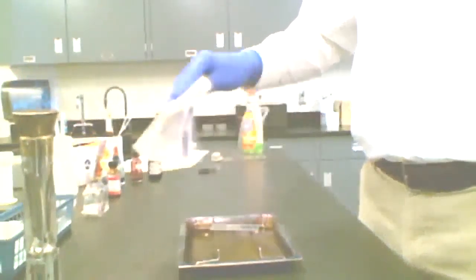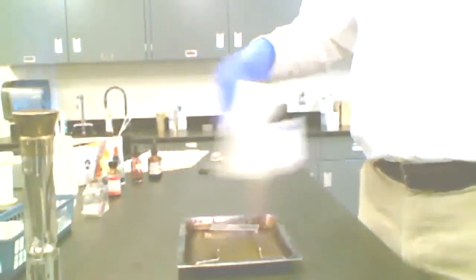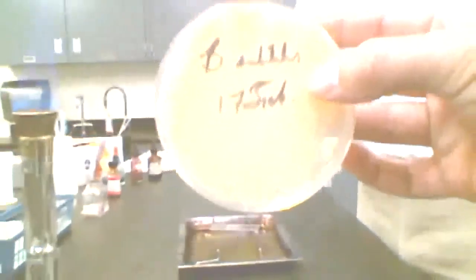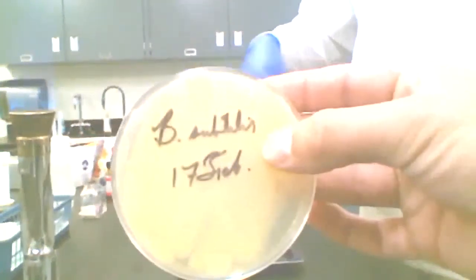We use that term because when we're culturing bacteria, now obviously all we're doing here is trying to create a stain to view the morphology, which refers to the shape or structure of the cells. But when we're doing cultures like the one in this example of Bacillus subtilis, we would be obtaining an inoculum from another culture to streak onto this one.